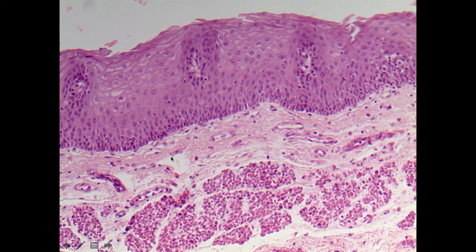This would then serve as the wall of the esophagus. Everything that we see from this point right here out to the surface, this is the epithelial layer. And you'll hopefully be very convinced that this is made up of multiple layers of cells. I mean, here we can see a very discrete cell. And so when we have multiple layers of cells, then we refer to that as a stratified layer. So this is a stratified ET.